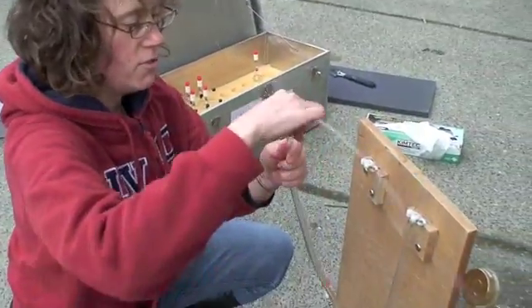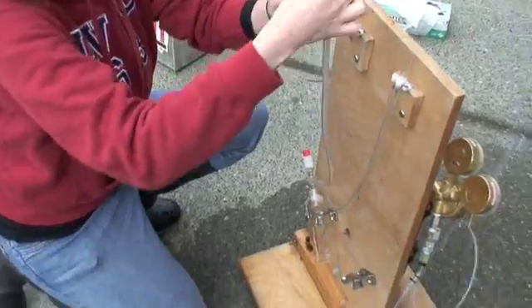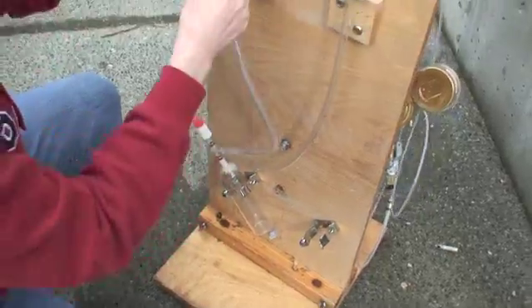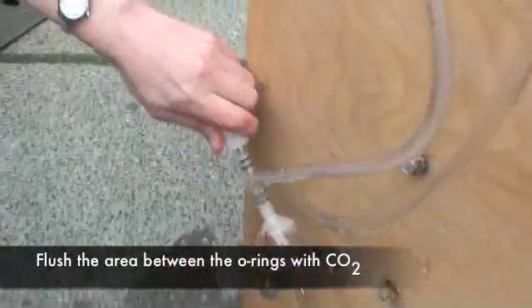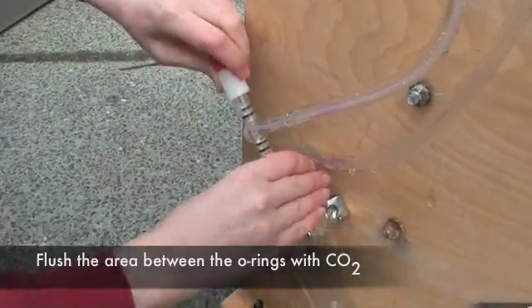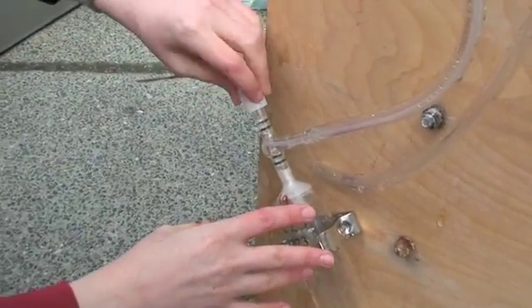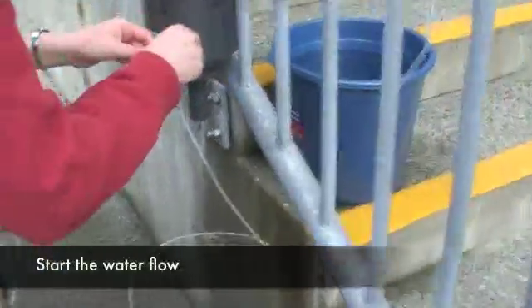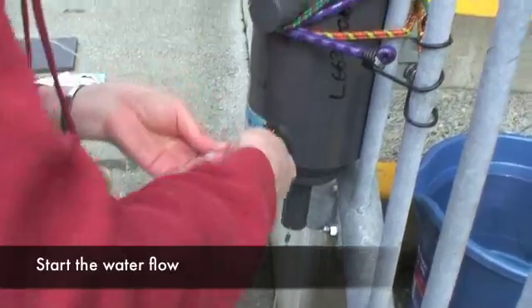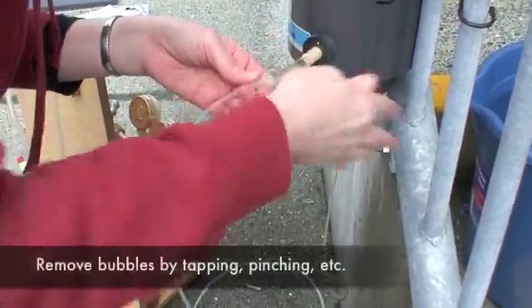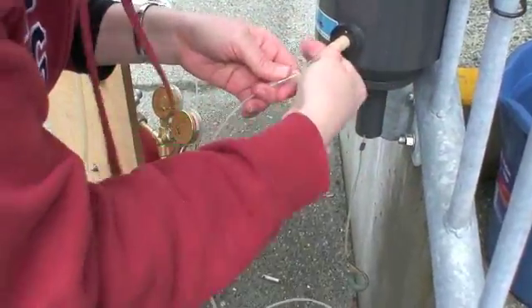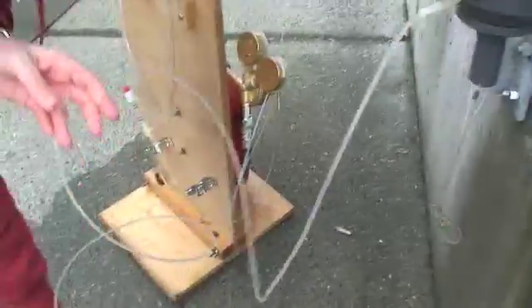It wasn't quite enough CO2, so I turned it up a bit. Open up this space, expose the space between the O-rings to the CO2. Start your flow of water, get the bubbles out. Okay, that looks good.